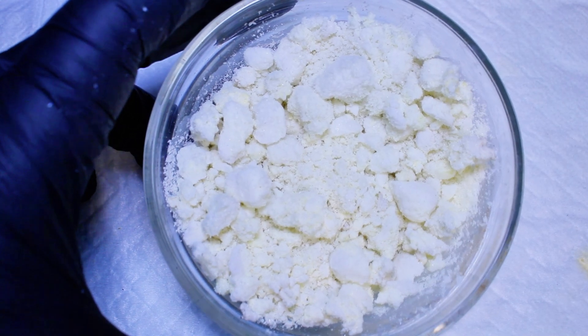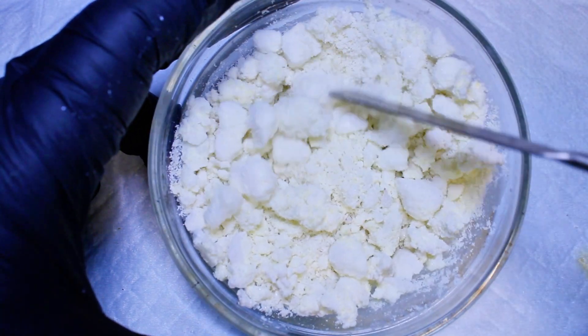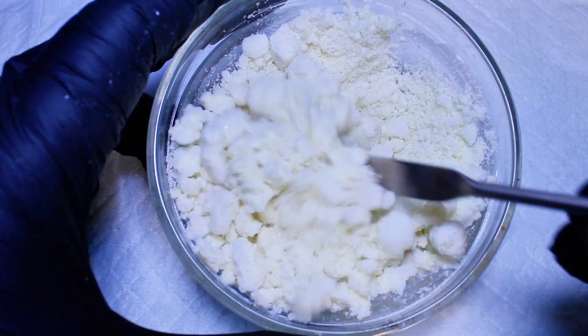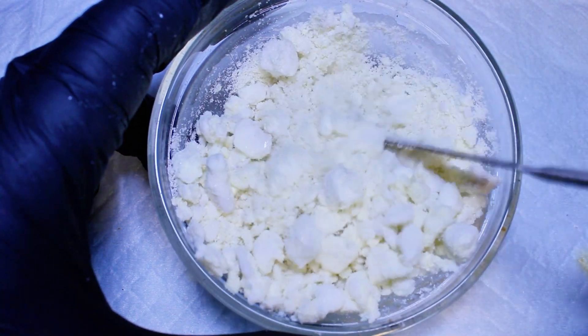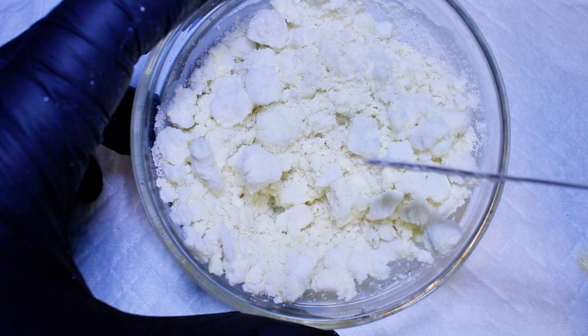At this point, the aniline hydrochloride is further dried under a full vacuum for several hours, and this is done because drying to completion using heat alone would result in a heavy loss of product to sublimation.